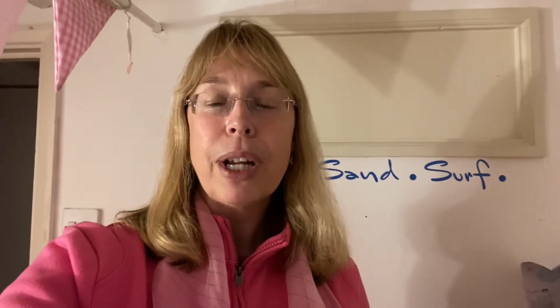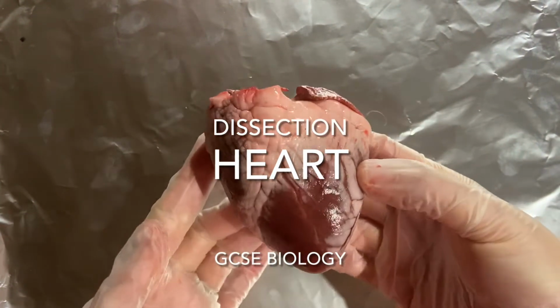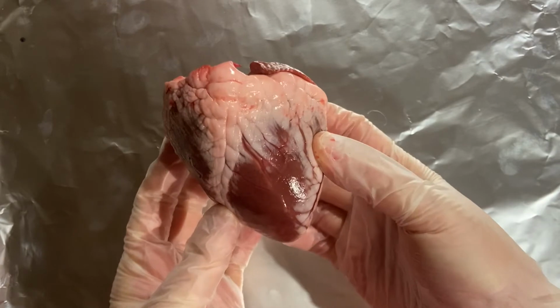When I dissect a heart, we really just tend to see the ventricles rather than the atria. It just all depends on the luck of the draw of what we get from the wonderful butcher who donated this for your lesson. So in this lesson, we are going to do a heart dissection. And over here, you can see this beautiful heart. And in fact, this is the heart of a lamb.